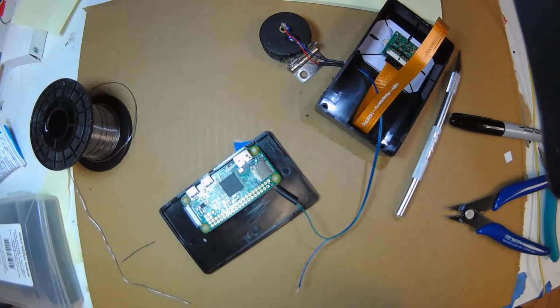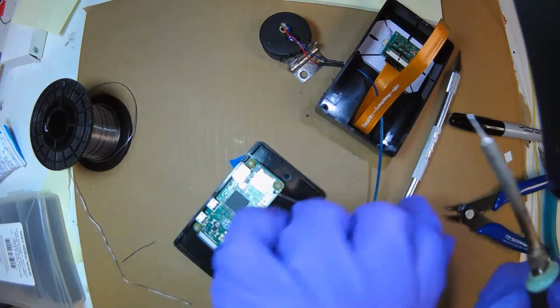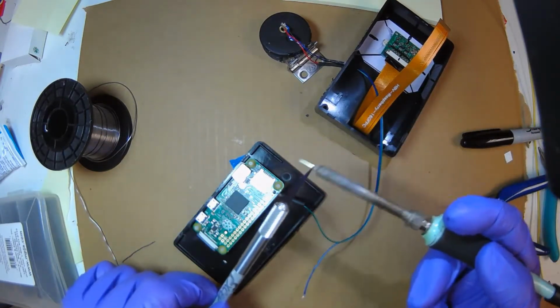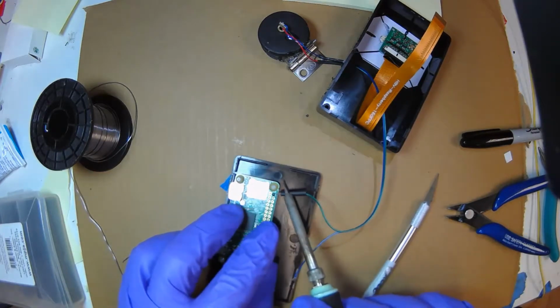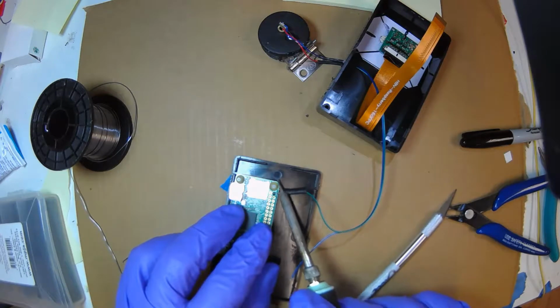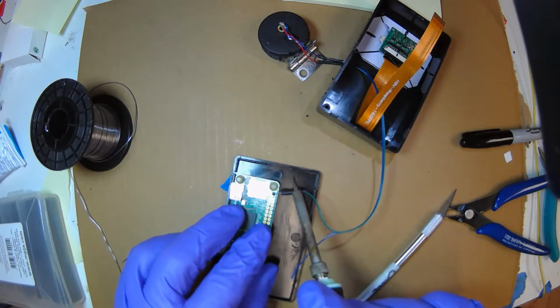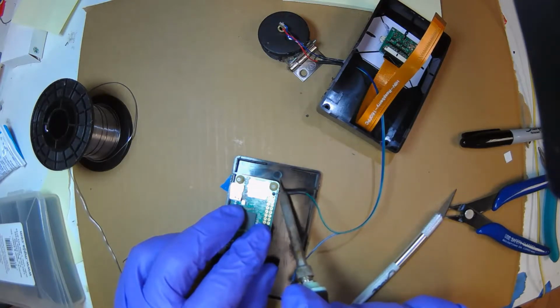That's what you want. Okay, I'm going to clean my iron because I don't want lead all over this. I'm going to put it in the corner here. Remember the corner? And I'm going to rub it, and it magically shrinks. Shrink tubing is great stuff. Before that, people used a lot of black tape, but this is a lot neater. And shrink it on the resistor too.